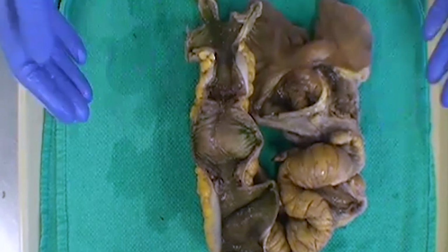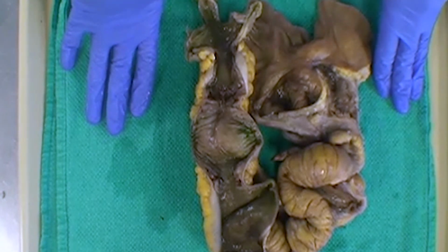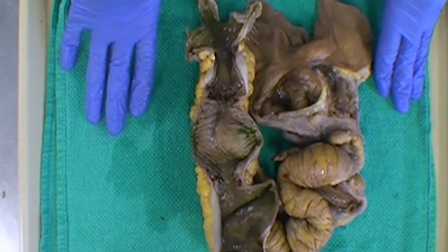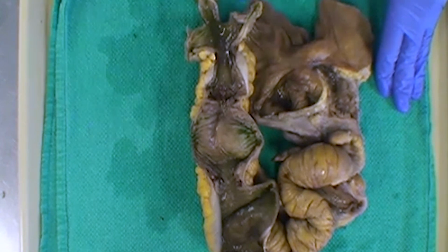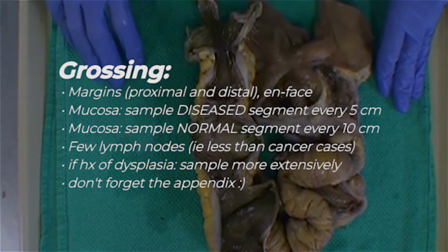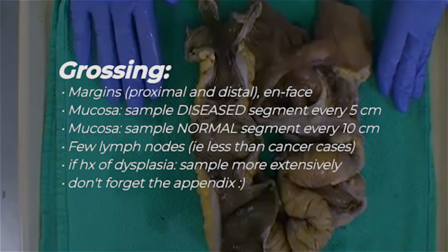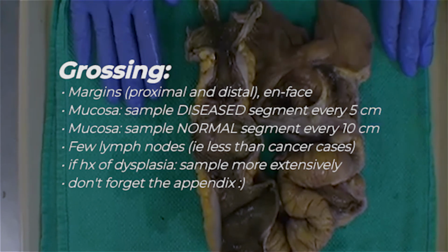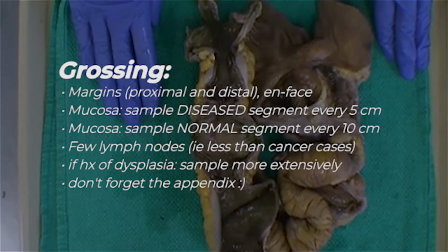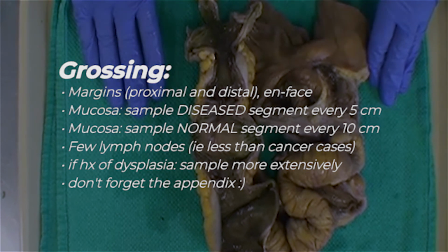And so the approach to grossing a specimen like this is actually quite similar to what we would do with the previous UC case. We again have our systematic approach starting proximally, taking our margin en face. We would then proceed to take sections, either one per every 5 centimeters if we think the mucosa is involved, one per every 10 centimeters for mucosa that is uninvolved. And then we would take our distal margin and again look in the fat for any sort of abnormal nodules. And if we don't find any, we would just submit some representative lymph nodes if we can find them.